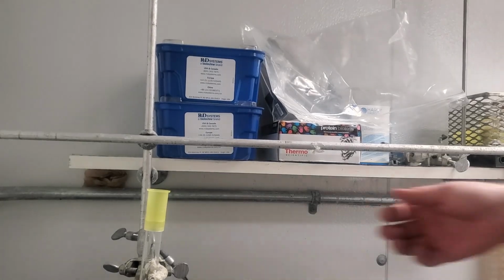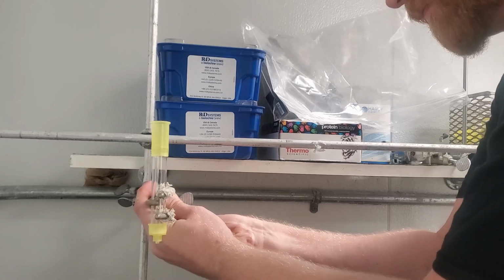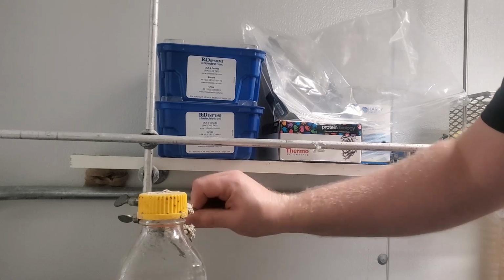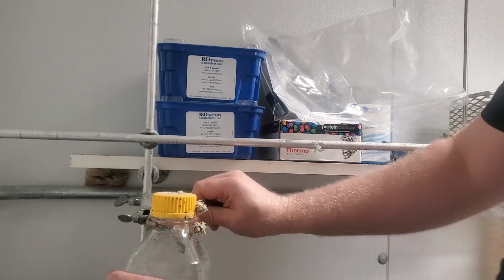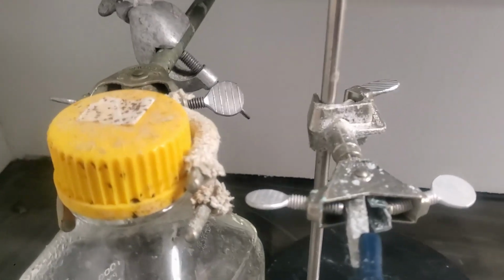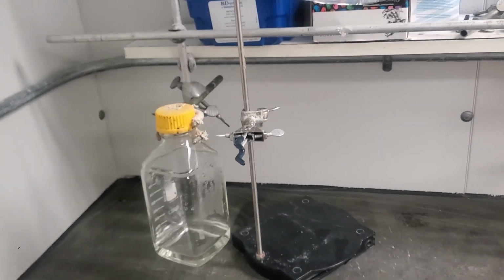One idea may be something like thumb screws. We use thumb screws to hold glassware when we're doing things like constructing filtration columns. They work great for attaching different things at different levels, and you can swap them out to attach things of all different sizes. So, could we use something like this that already is designed to hold different types of glassware to hold different types and sizes of tubes? Well, the big problem is that the thumb screws themselves take up space. We couldn't get our tubes close enough together to form any kind of a practical rack. Only if you wanted a tube rack the size of a lab bench could this work.